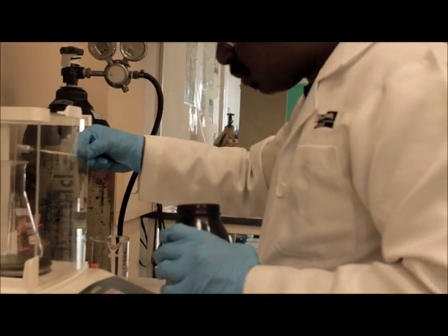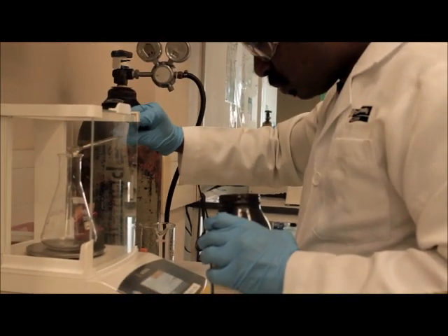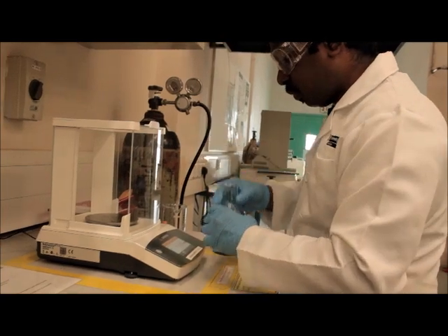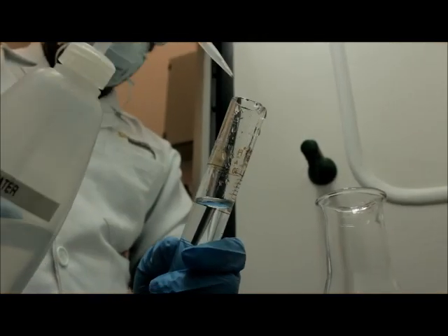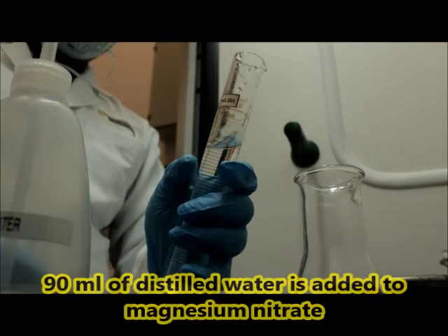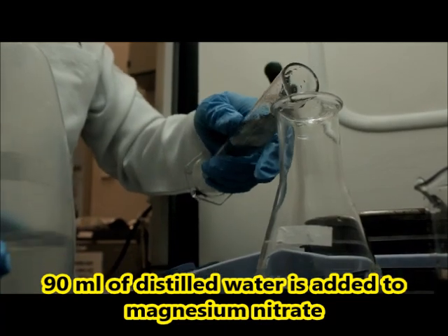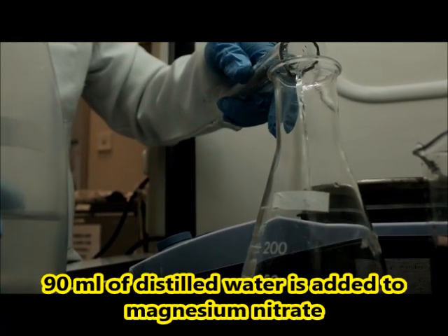Magnesium nitrate is used as the magnesium precursor. 90 milliliters of distilled water is added to the magnesium nitrate to dissolve it.